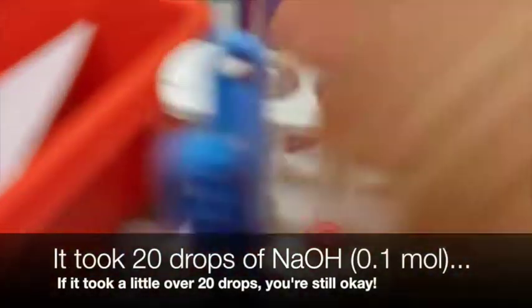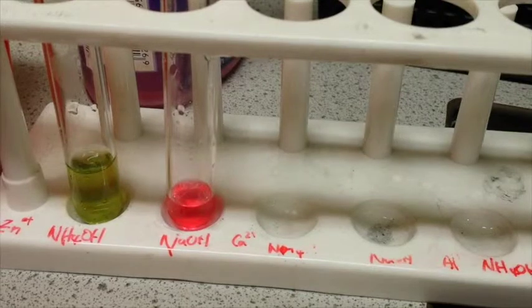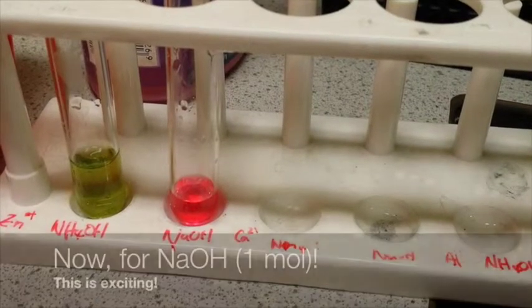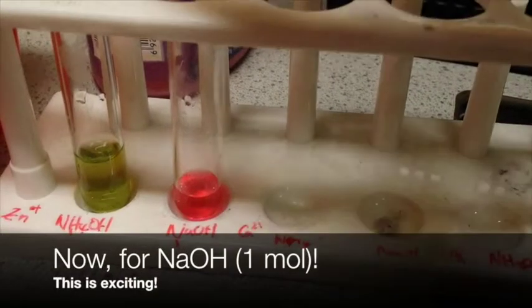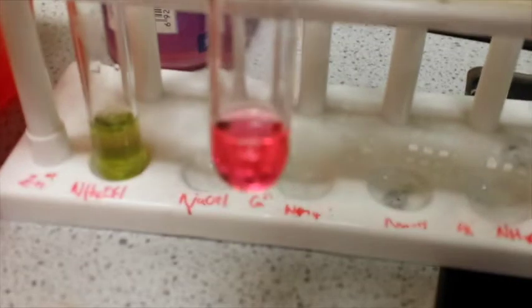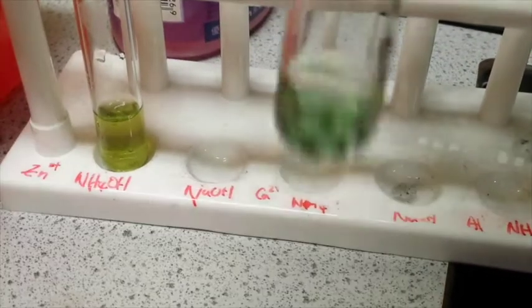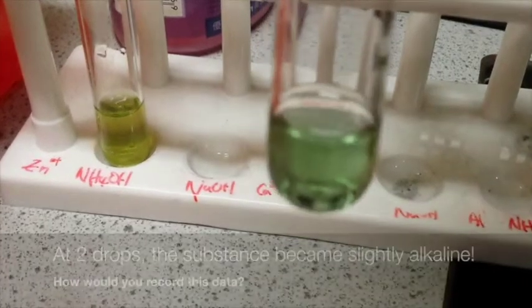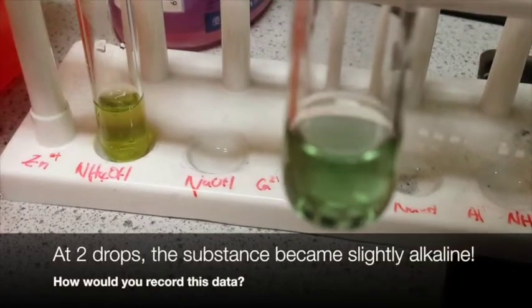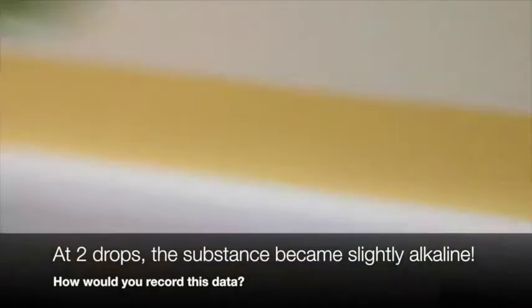What about the 1 molar? So let's try now the 1 molar. So 1 drop. Okay, at 2 drops, it became a little bit alkaline already.